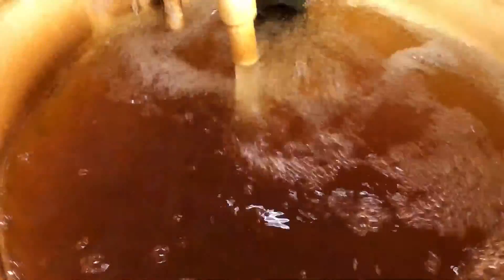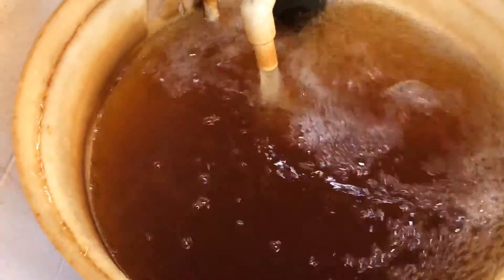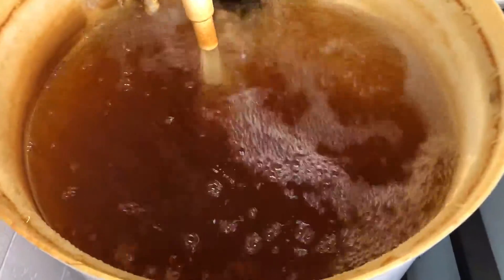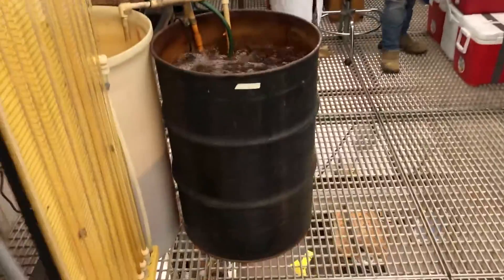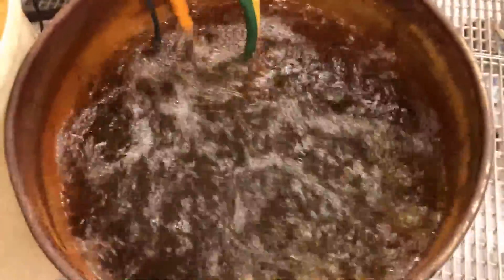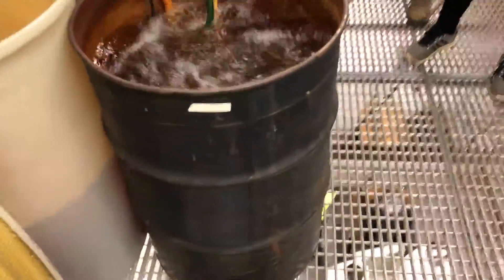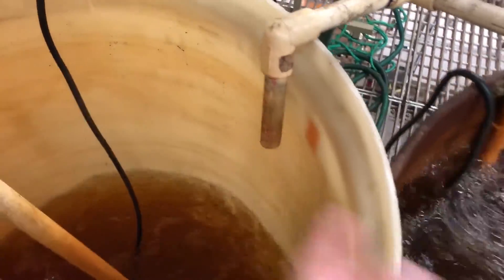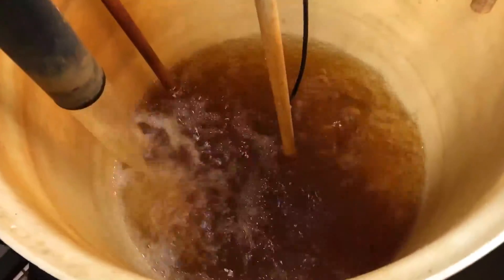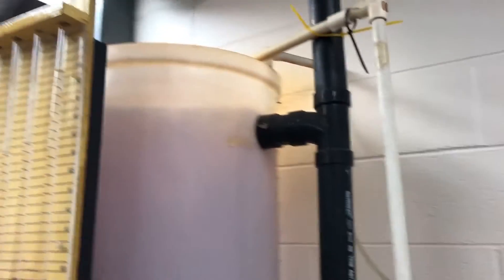To give you a picture of what it looks like at the top — there's our water being aerated and pumped, not boiling. He grabbed some of that. This is where we mix the water up, adding ferric chloride and sodium hydroxide to get our flocs in this barrel. We then transfer it from this barrel to the next one through this pipe because there's a sump pump at the bottom.